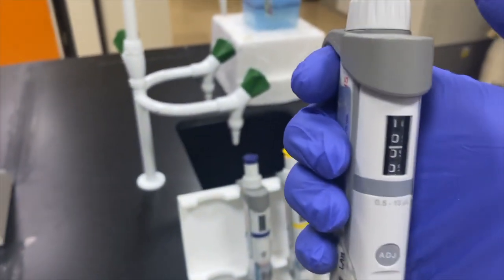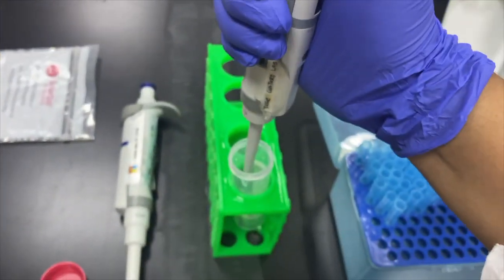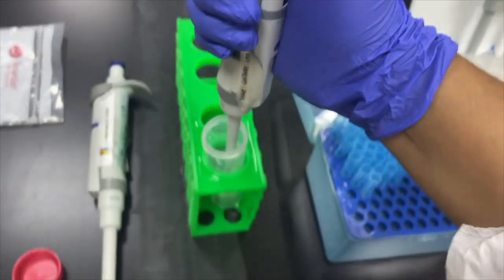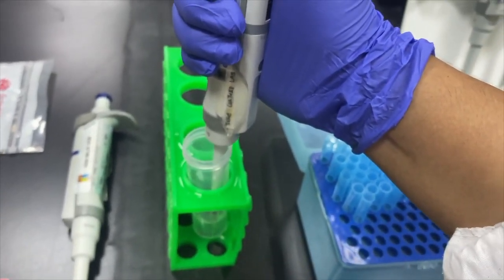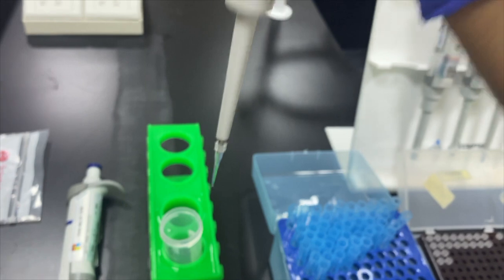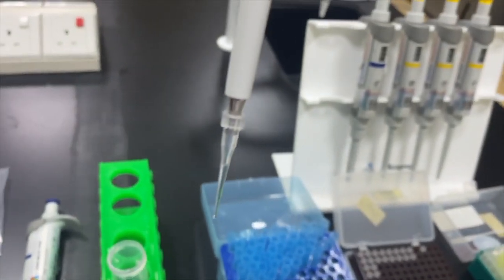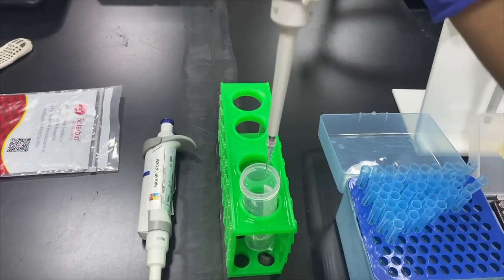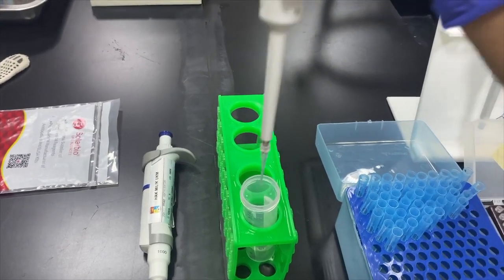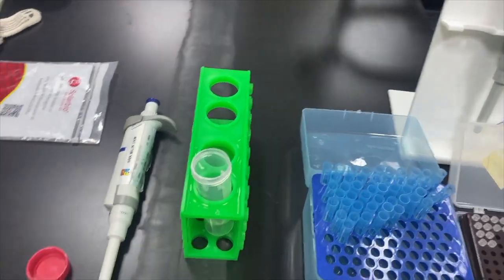Okay. So, it's already set for 10 microliter. And then you just press first. Put the tip inside. Take. And this is 10 microliter of the liquid. Okay. So, you can just put this pad. Just like that. And then you discard.